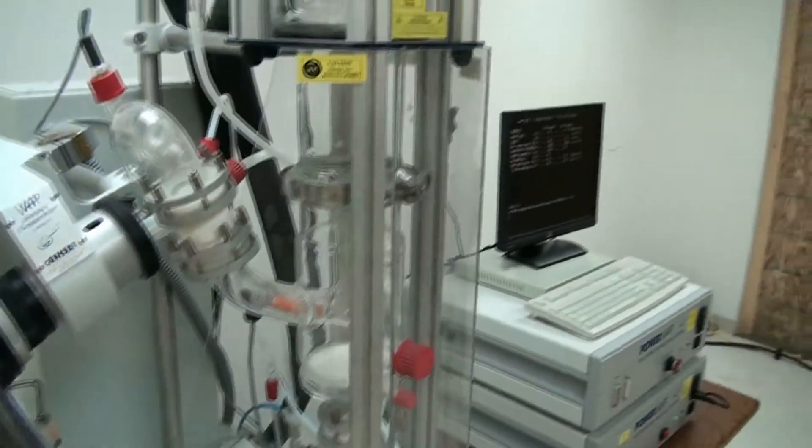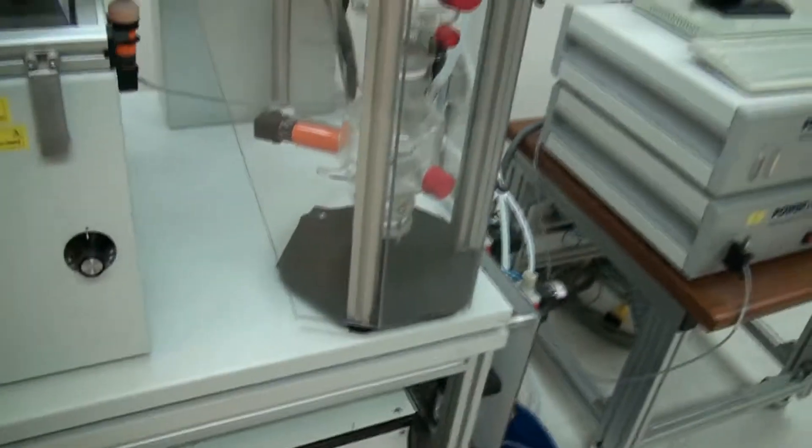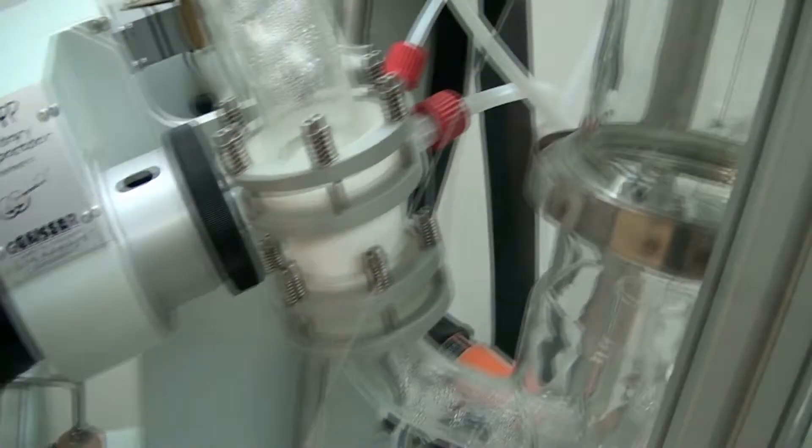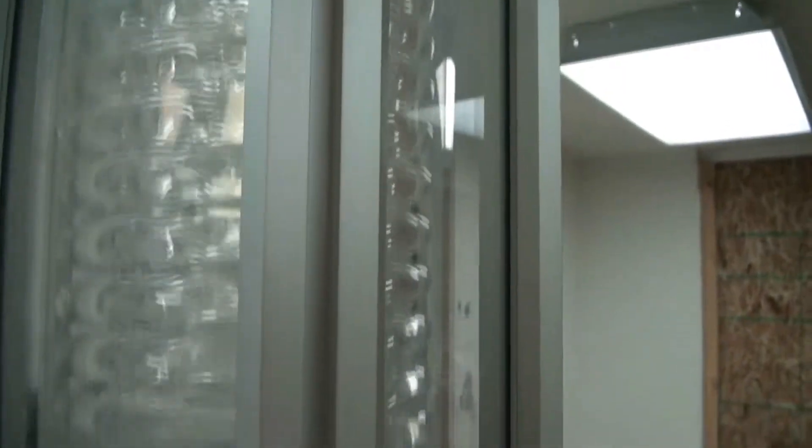You can see a little bit of condensation on the bottom there, the coil dripping. This coil right now is filled clear up, it's just continually circulates. As the vapors come through the trap here, they go in here and they come up and then they build against the coil and then condensation develops.